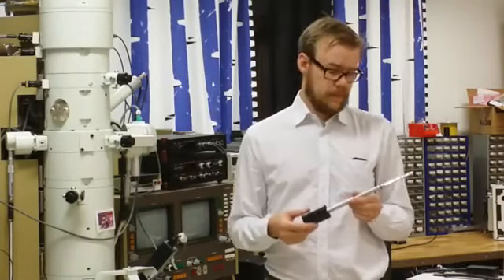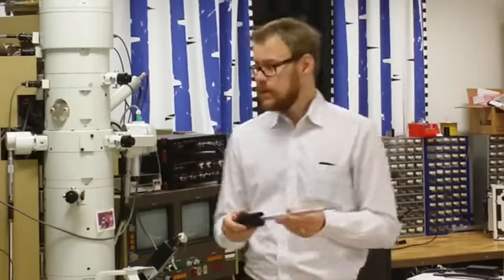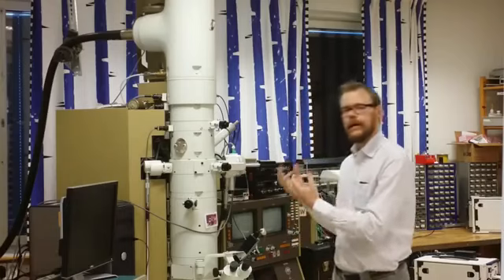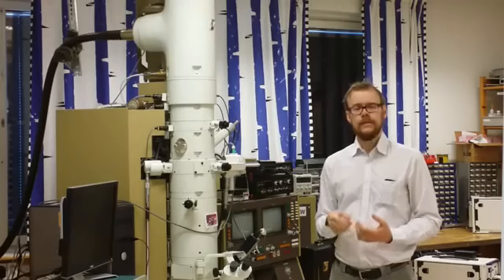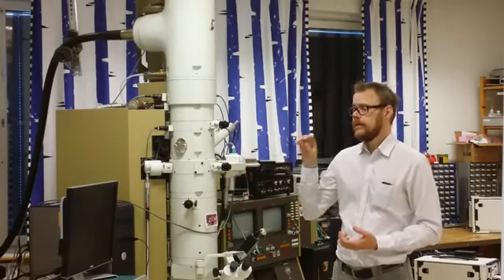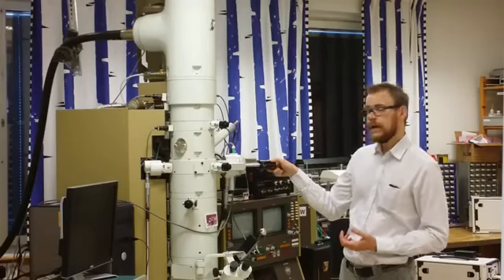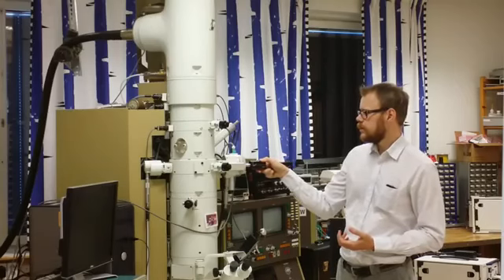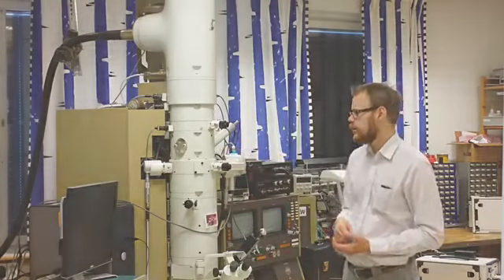So here I have the sample holder. The sample has already been mounted at the top here. We insert this sample holder in the side here at the midsection of the column. The vacuum will start to pump, and this usually takes a few minutes. So now when the air has been evacuated in this pre-chamber, we can rotate the sample and gently insert it inside the microscope. Be careful though that you continually hold and grab the holder while you insert it. Otherwise it might go too fast inside and actually hit something and destroy that.